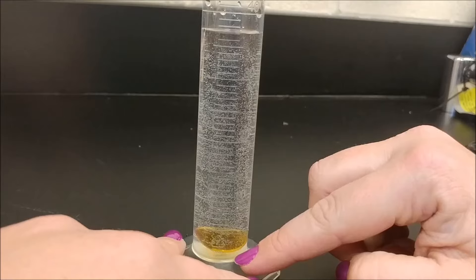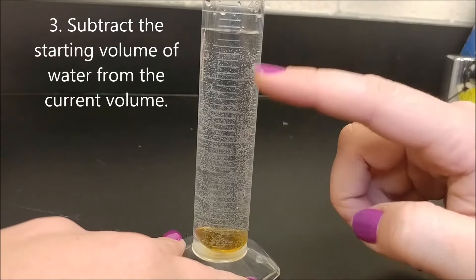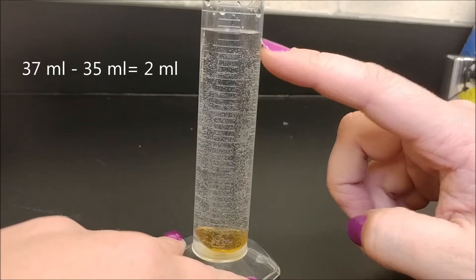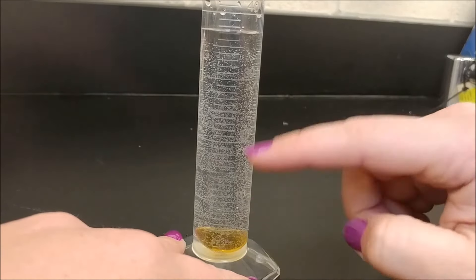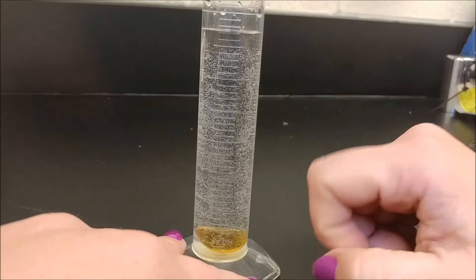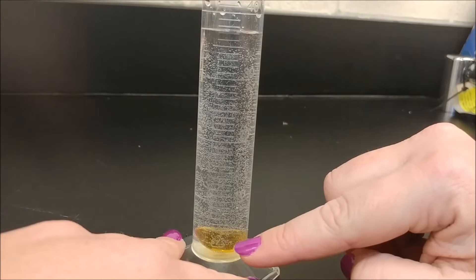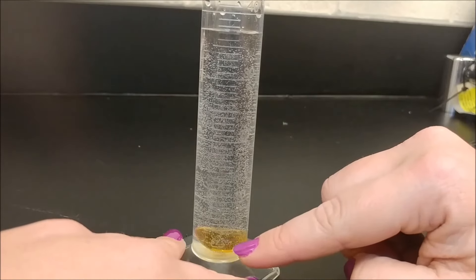So how much volume then is in that glass pebble? What's the difference? I was at 35, now I'm at 37. What caused that volume to change? The marble — it took up 2 milliliters worth of space because 37 minus 35 is 2. So this glass pebble has 2 milliliters worth of stuff inside of it, meaning it takes up that much space.